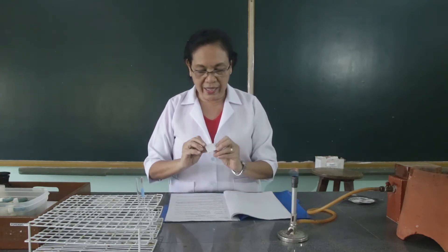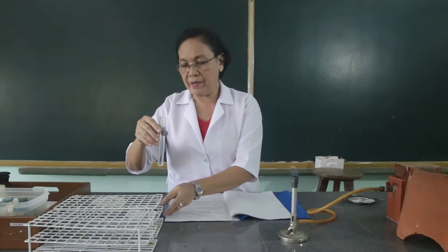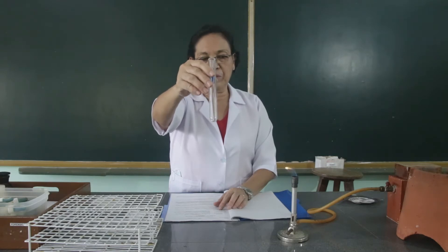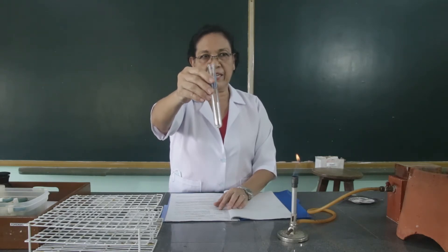For the first part of this activity, we are going to prove the presence of carbon and hydrogen. In this case, we are going to heat a piece of casein in the test tube. So this is the casein inside the test tube, and I want you to observe what happens after I am going to heat this.